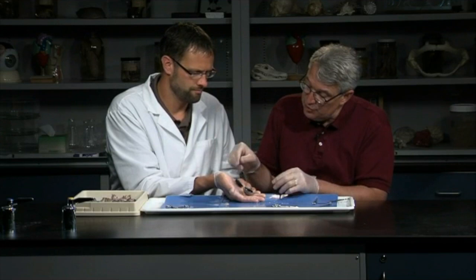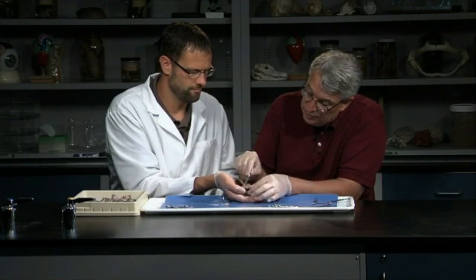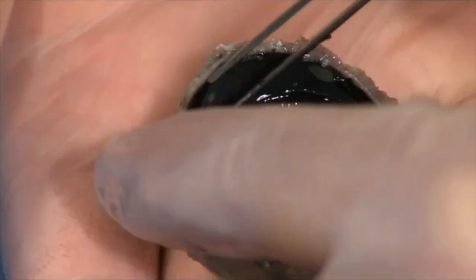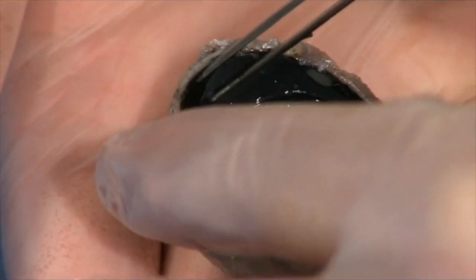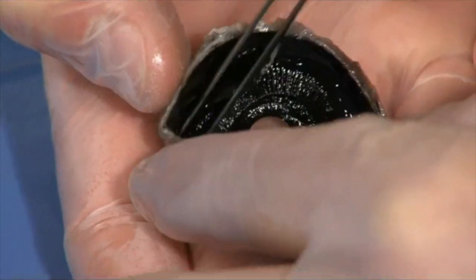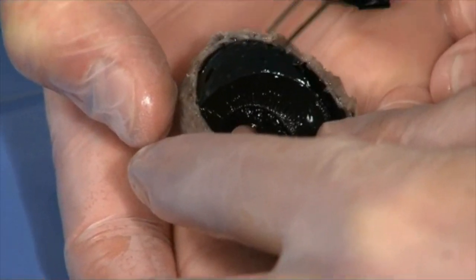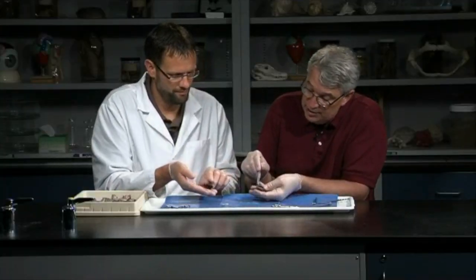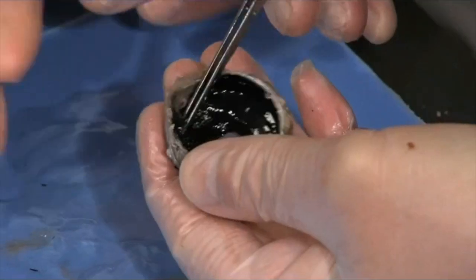And see, this one's been pulled out. Once you've looked at all those structures, you can usually get it out. Sometimes you've got to find a place where it's loose. There it goes. And once you get that loosened, you can then pull that out. I'll let you grab it there. I probably better have it on my hand here. Not sure I have the right tool either.